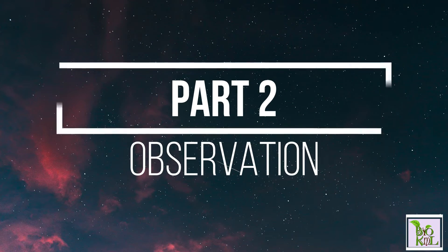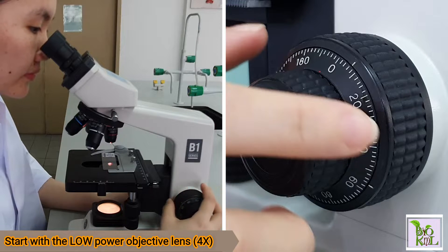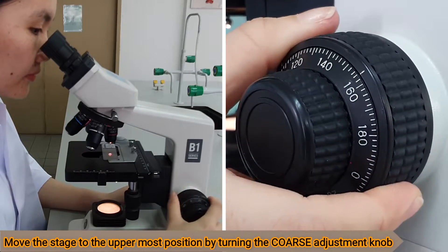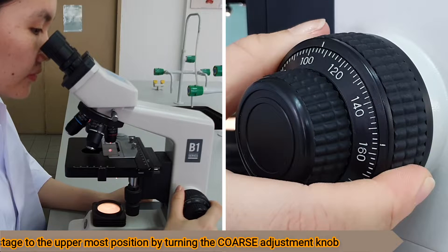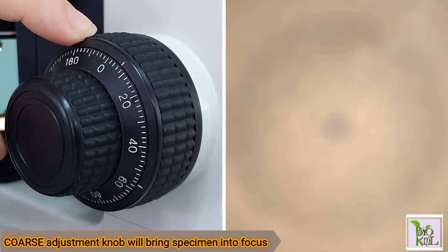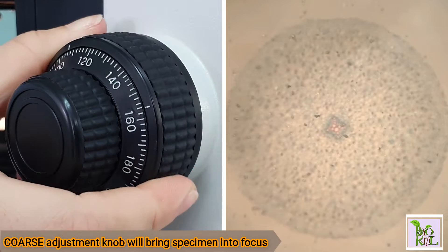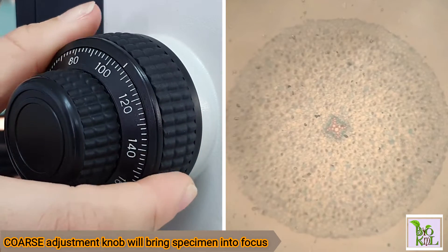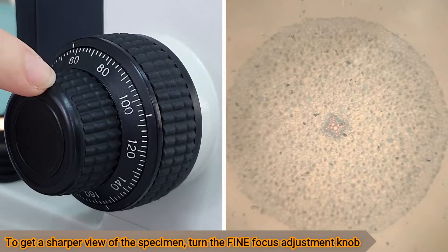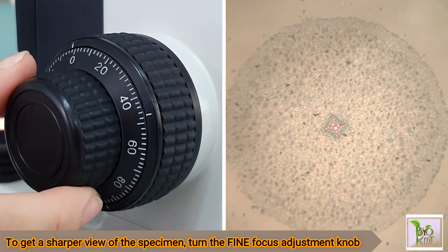Part 2: Observation. Start with the low power objective lens at four times. Move the stage to the uppermost position by turning the coarse adjustment knob. The coarse adjustment knob will bring the specimen into focus. To get a sharper view of the specimen, turn the fine focus adjustment knob.